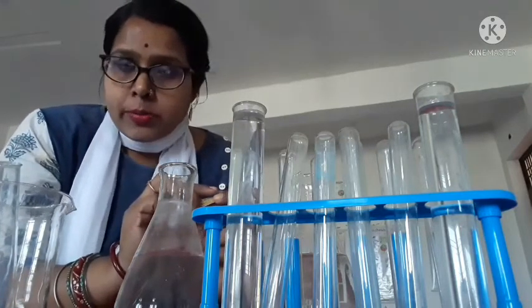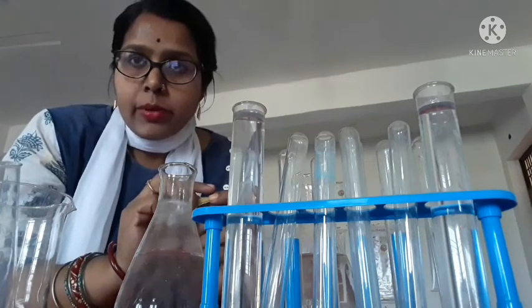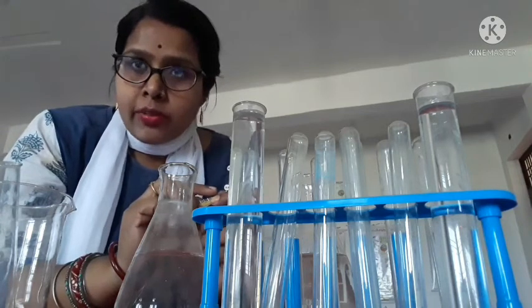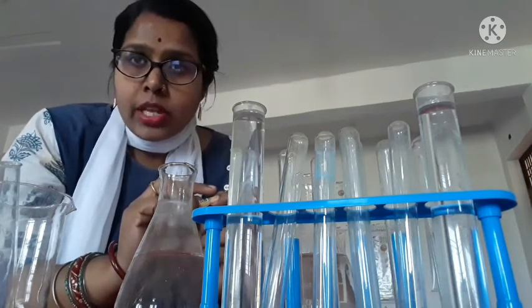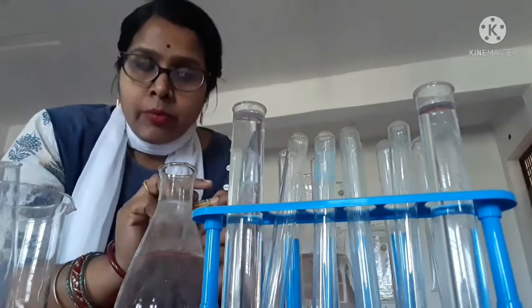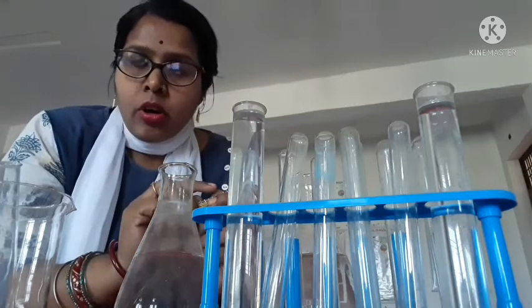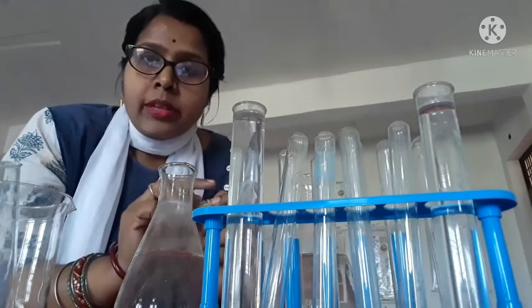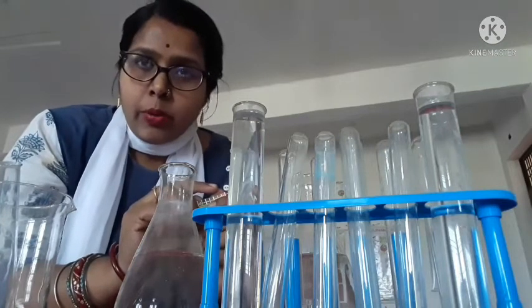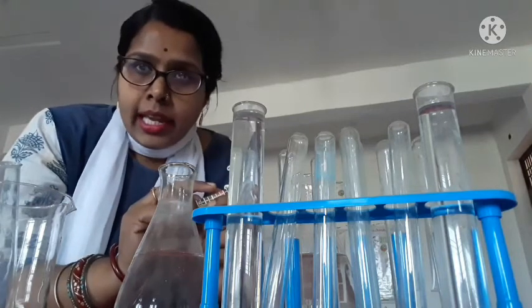So from the experiment we conclude that the water's quality depends on the pH. You know, the pH scale has neutral at 7. If it is below 7, that is the acidic medium, and if it is above 7, that is the basic form. So it is below 7, so both have some acidic level: the river water and the pond water are acidic.